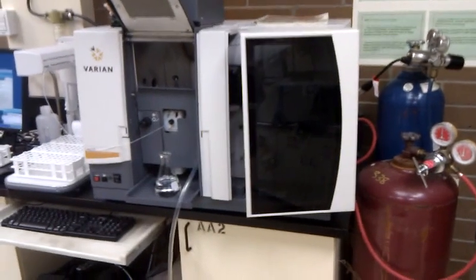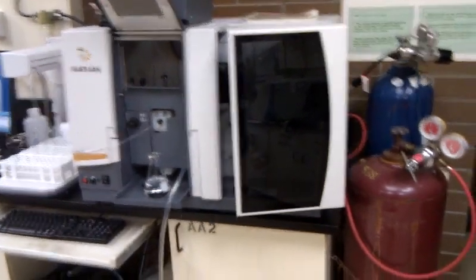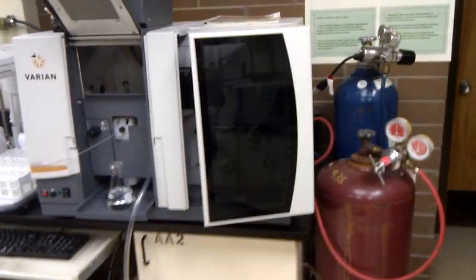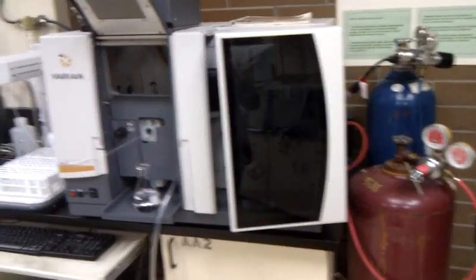This shows the AAS instrument as a whole. You can see the acetylene gas hooked up on this side. And if we open this door, we've got a series of four lamps.